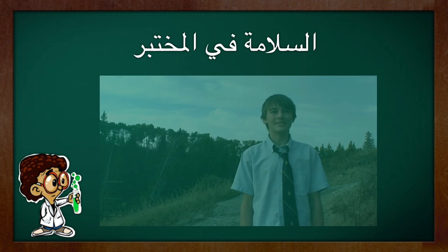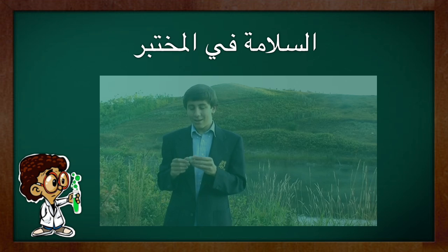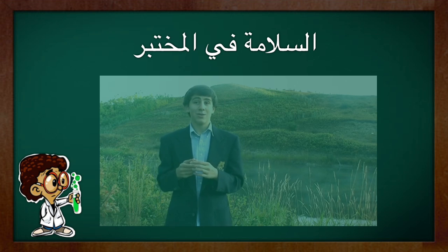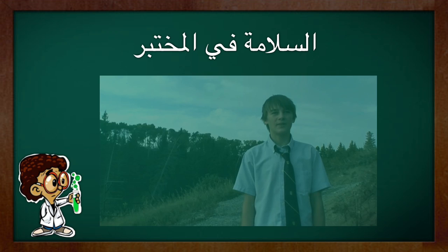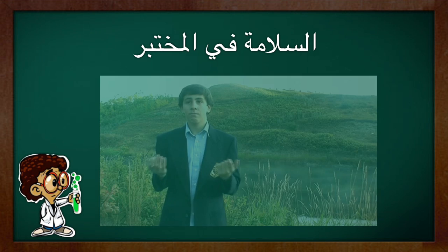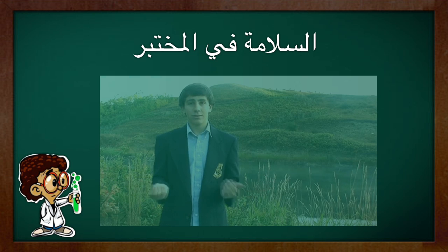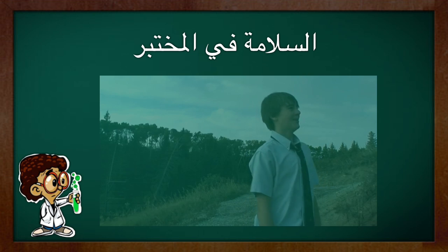Hey Brandon, what's that? Well, this? This is just some sodium I jacked from Miss Marcuccio. So, do you want to play catch with it? Won't that explode if it touches water? Mitchell, do you see any water around us? I guess you're right.